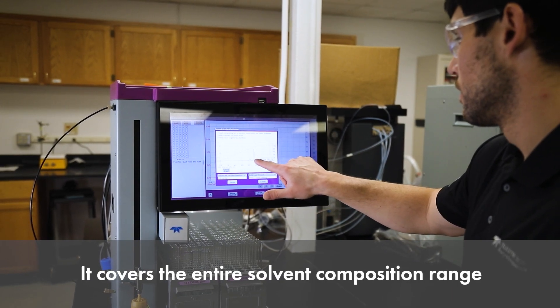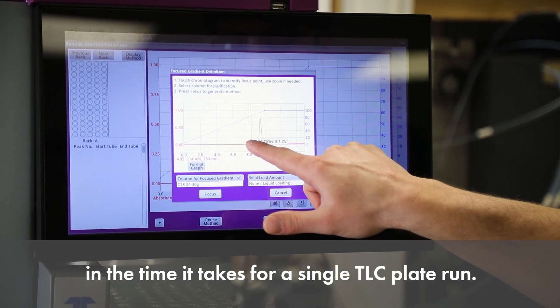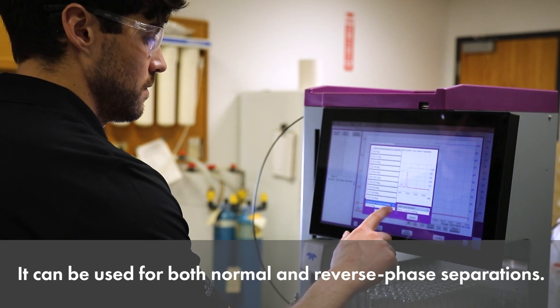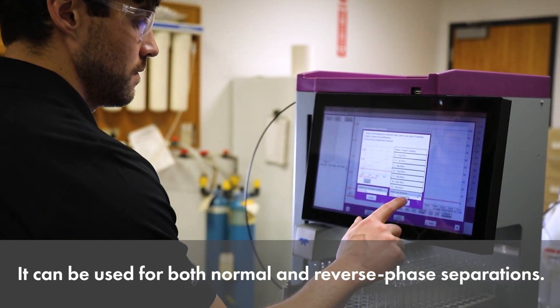It covers the entire solvent composition range in the time it takes for a single TLC plate run. It can be used for both normal and reverse phase separations.